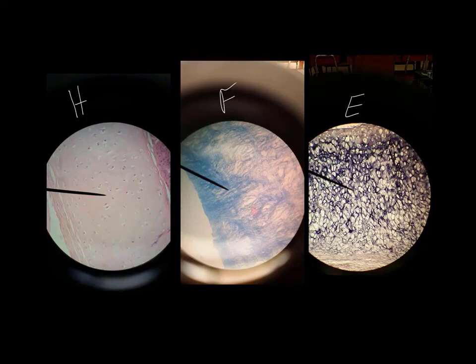And over here on the right, elastic cartilage, its function is to provide a great deal of flexibility, and we don't find it very many places in the body. It's found in the throat in a little flap called the epiglottis. The epiglottis bends when we swallow to cover up our trachea so that food or liquid does not go down into our lungs. And then also in the stiff portion of the external ear, so the upper part of your ear where it's a little bit stiffer, not the lower part, the lobe, but the upper part of your ear that you can bend and it's very stiff and it snaps back. So that's where we find elastic cartilage.